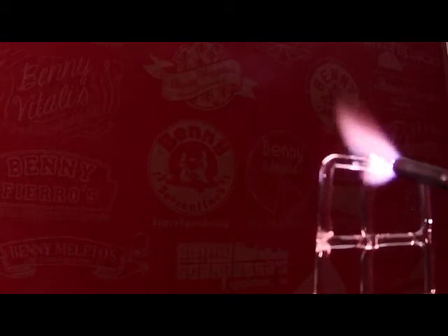Another way I could have made this is I could have put together a holding series of clamps and rods on, say, a ring stand, and then had all the glass in position, and then heated it with a torch, and then tack welded it, and then cleaned everything up. But as I was thinking about making this, I decided this would also, like I said, be good practice for me to have to do all of this with the stationary torch, with it freehand, and just move it around into position as needed. So this weld is pretty good. It's not completely done, but I do want to come back to this one, and then go from there.